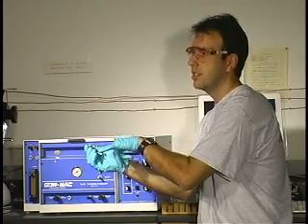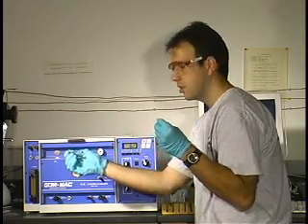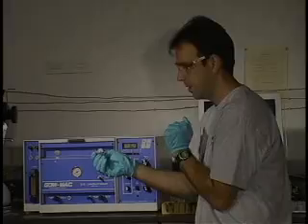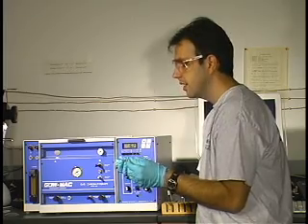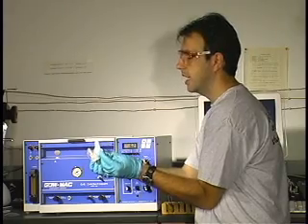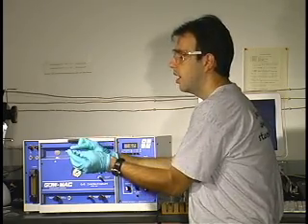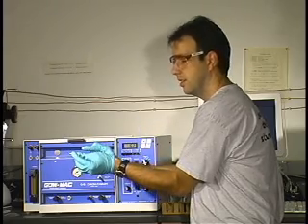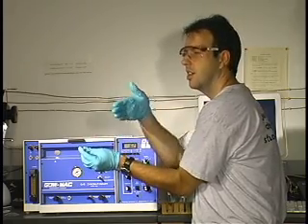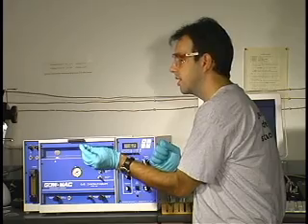Just push it in and then pull the whole syringe out. The second source of error is if you're injecting and you forget to wipe off the outside of the syringe. What will happen is you will have solution on your syringe needle as well as the solution inside your syringe. What will happen is you'll get something called peak doubling — you'll get two sets of peaks in your spectrum, and you'll see a picture of this later on in the video.